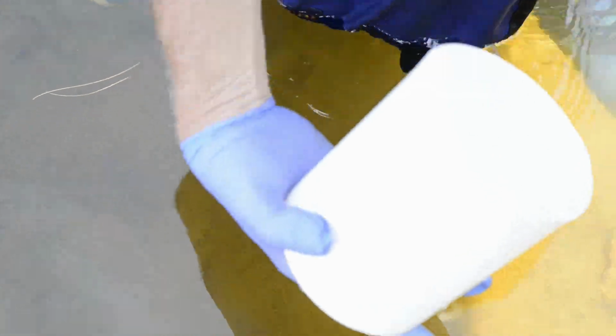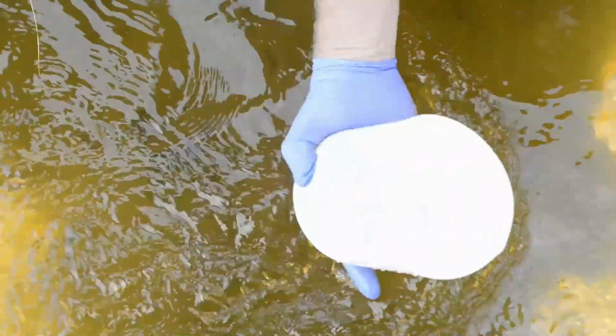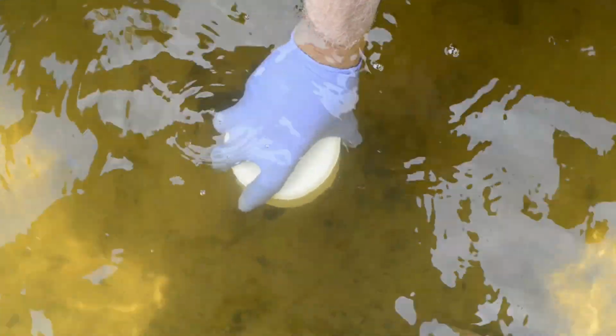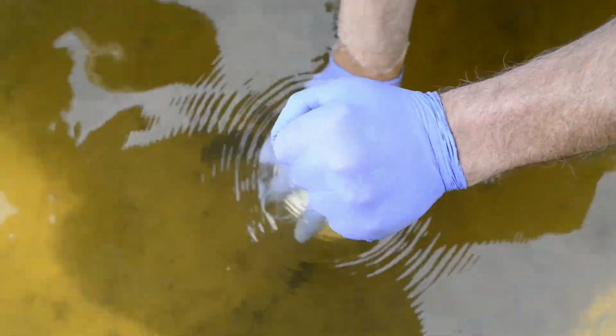What I do is take a Teflon beaker, it's nice and clean, and then we will sweep the top with the back of my hand. So that moves out all of the material on the top, and then I will submerge the beaker to 18 inches, and then I get ready to grab a sample. So we're going to put dye all over the top of this.